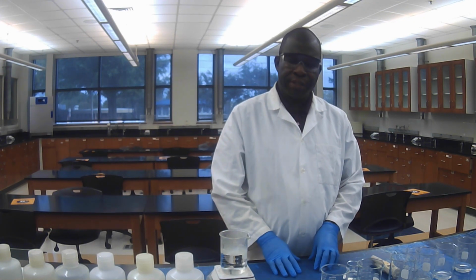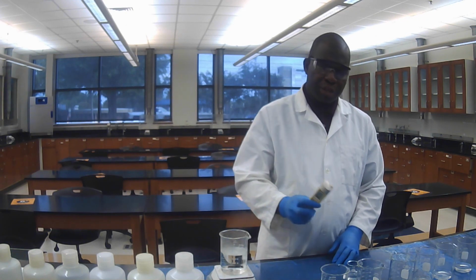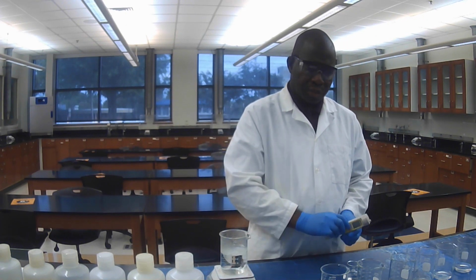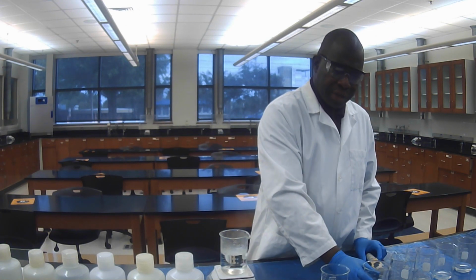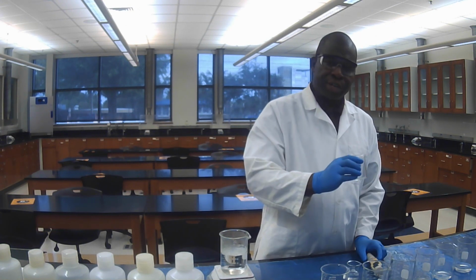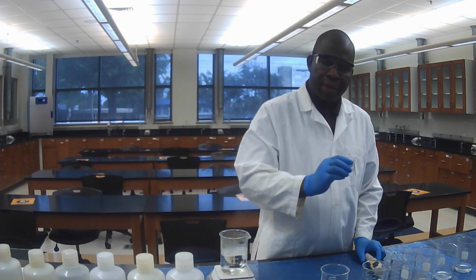So Ka stands for acid ionization constant and Kb stands for basic ionization constant. Now to perform part 1 of the experiment, you need a pH meter. You also need a 400 milliliter beaker, a 100 milliliter beaker, and a 50 milliliter beaker.